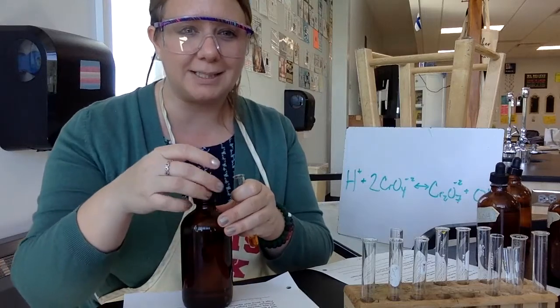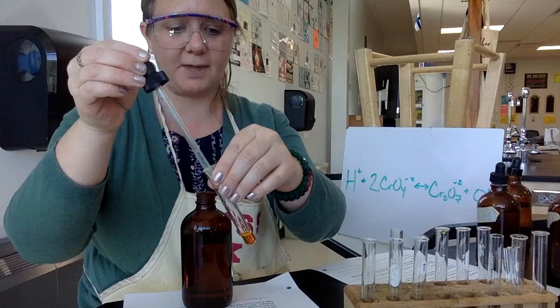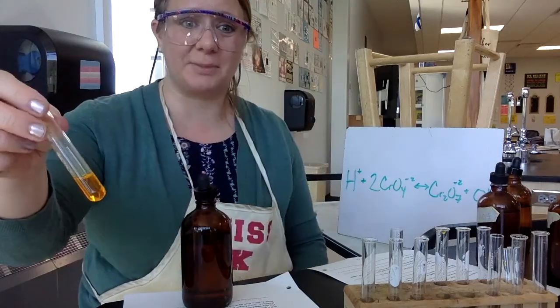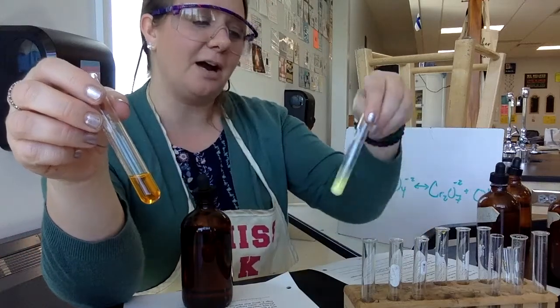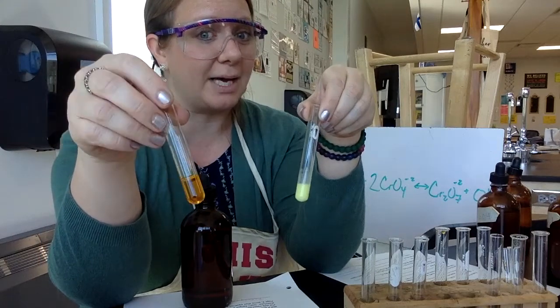Think about what you might see. Make a prediction. Do you think you'll see a precipitate or not? All right, a couple drops of that, and it doesn't really look any different, right? It's pretty much the same as it was before. Well, that tells us something. Here, I shifted it so that I got a precipitate. Here, I shifted it so I didn't.